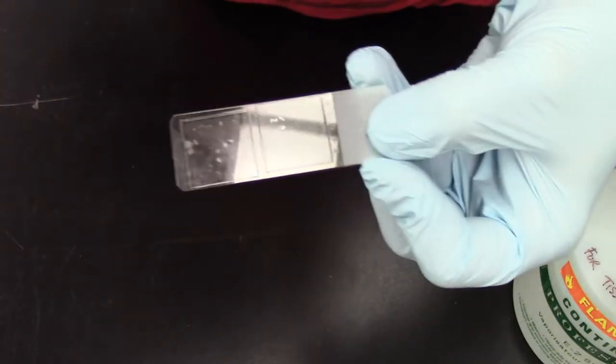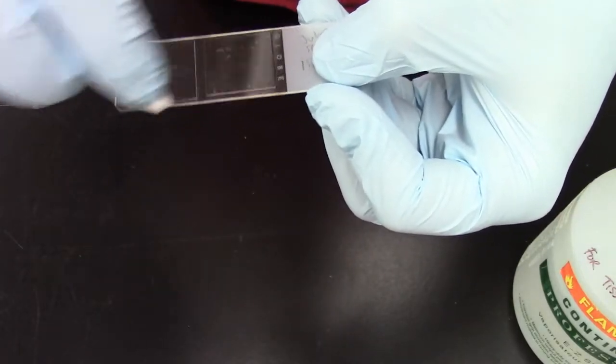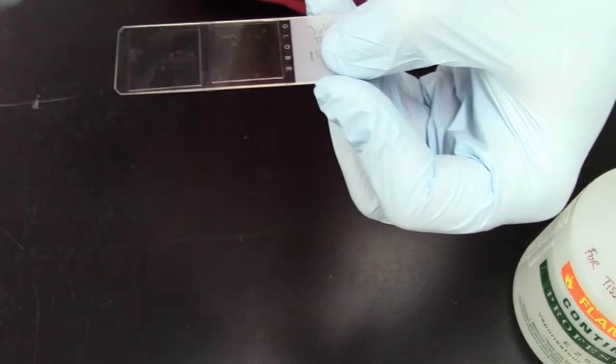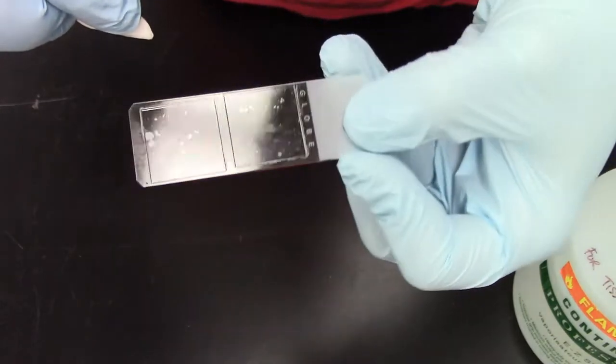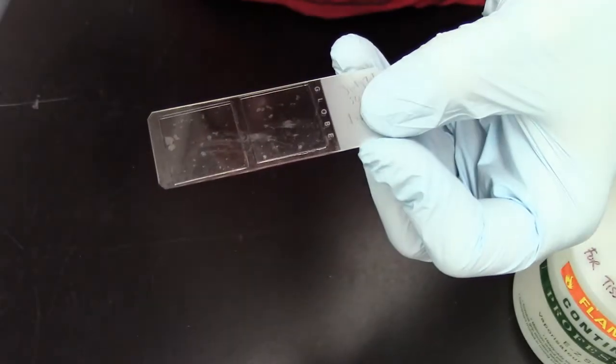So now we clean the other one. And please note that I do not press very hard. I do it very lightly. I do not press too hard because if I do so, the coverslip will move and then we cannot really image it anymore.